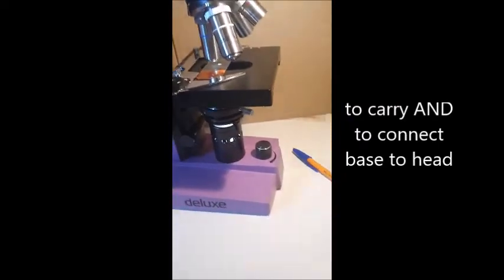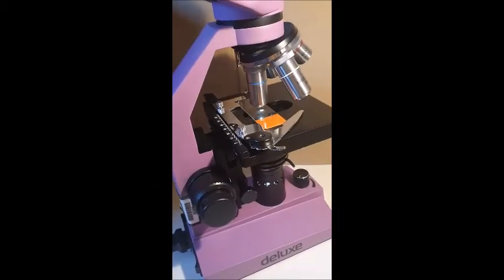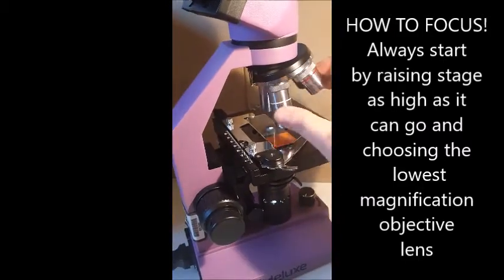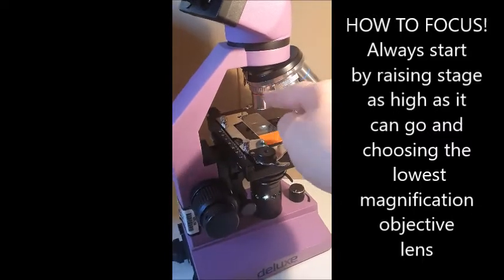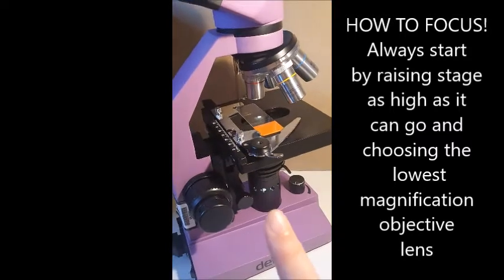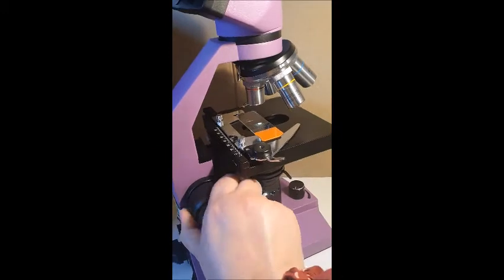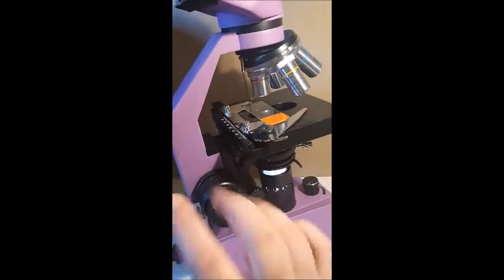Now I'm going to show you how to focus the microscope. To start with focusing your microscope, you need to start on the smallest objective lens. So the smallest one we have here is the 4 times, and 10 times, so that's 40 times. So it's on the smallest one, and then we use the coarse focus to bring the stage all the way up to the top. So that's as high as it can go, can't go any higher. And then we look inside.